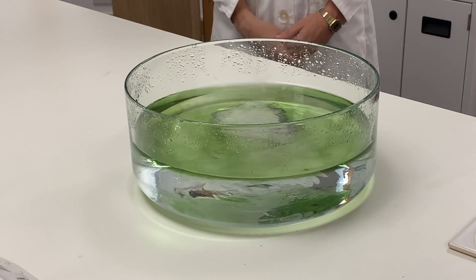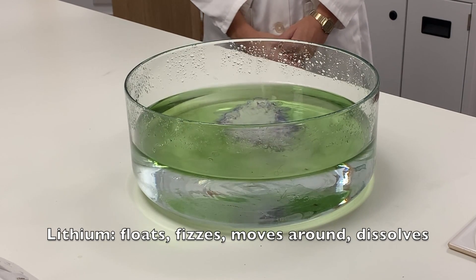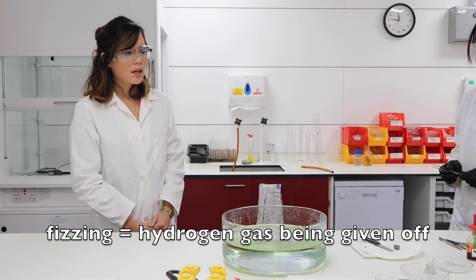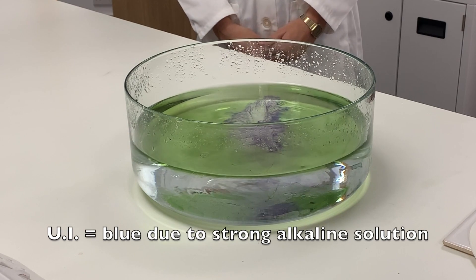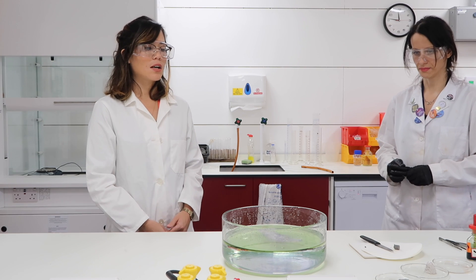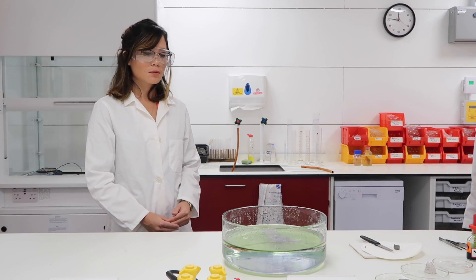As we can see, the lithium is floating, it's fizzing, it's moving around. The fizzing is hydrogen gas being given off. Notice that the Universal Indicator has turned blue-purple — that shows that a very strong alkaline solution has been produced. We're looking at a pH of around 13. And that's actually why Group 1 metals are also known as the alkali metals.